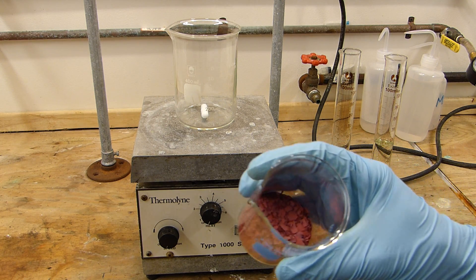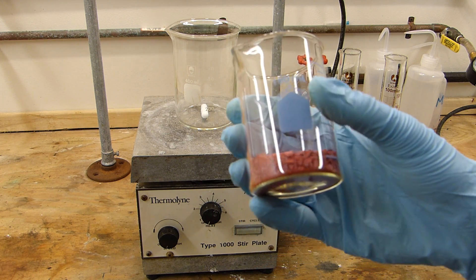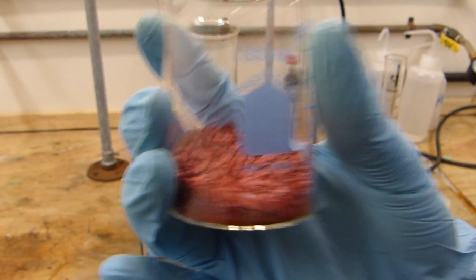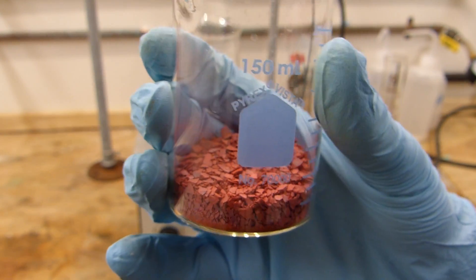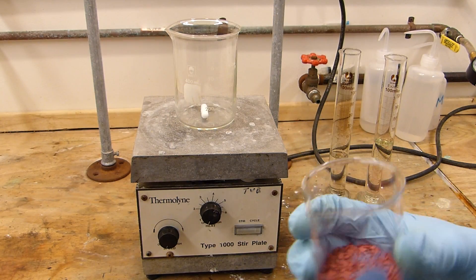I also have here 50 grams of commercial chromium trioxide flakes. It actually looks almost like fish food but you definitely would not want to feed that to your fish. Probably dissolve your fish or catch it on fire.